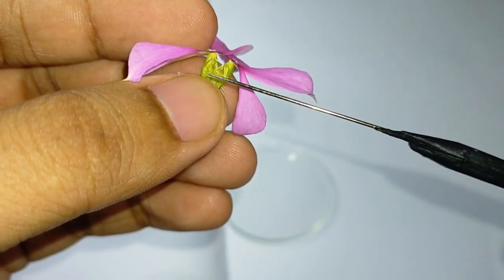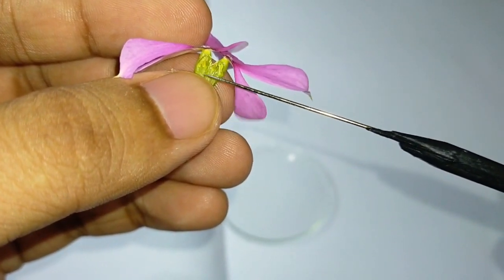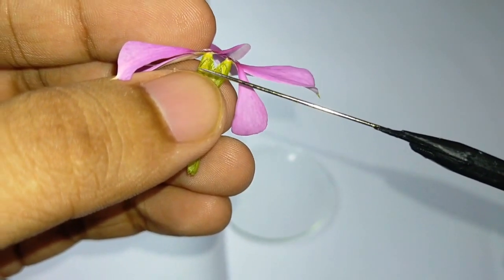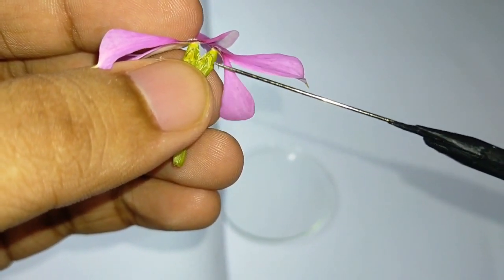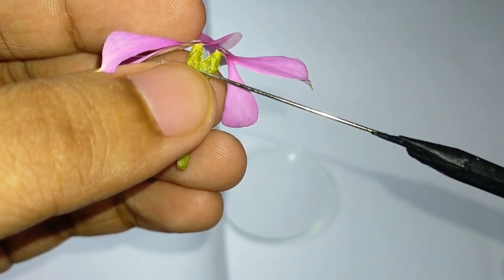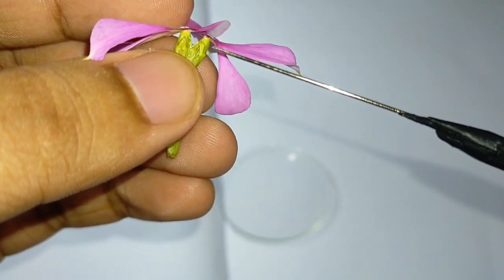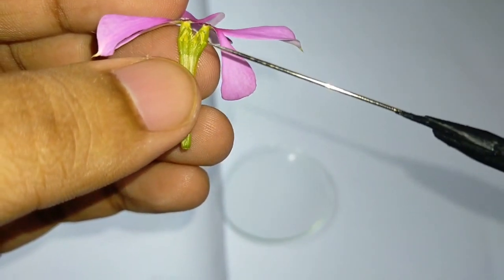All five stamens are united to the petals by their filaments. The anther is a bilobed anther and it is basifixed, because the filament is connected to the base of the anther. So it is basifixed.